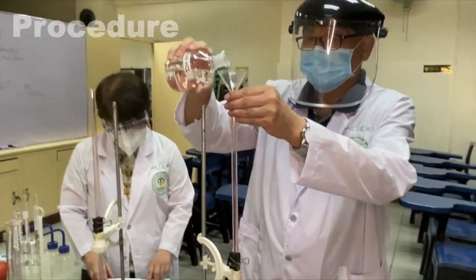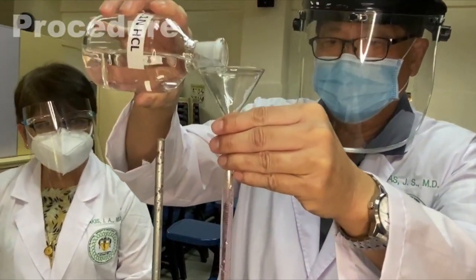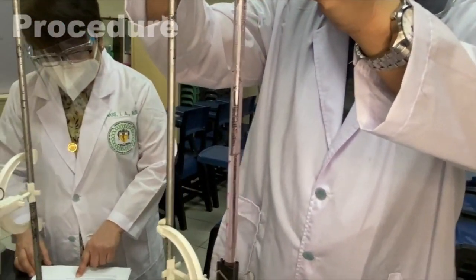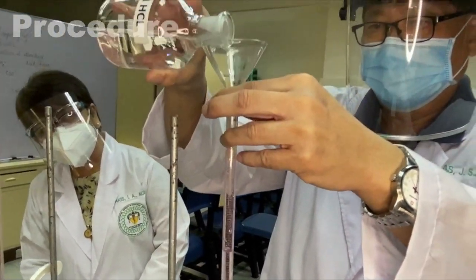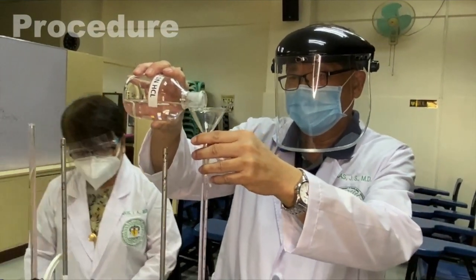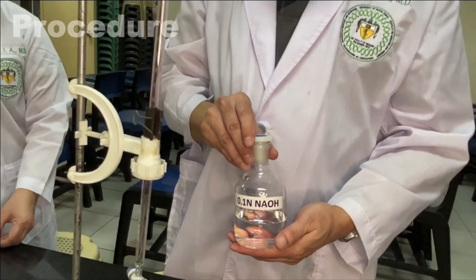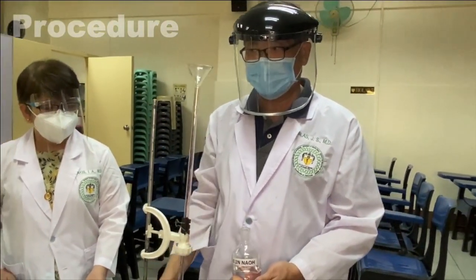We now prepare our titrants. Take two burettes and fill the first with 0.1 normal hydrochloric acid, and the second with 0.1 normal sodium hydroxide.